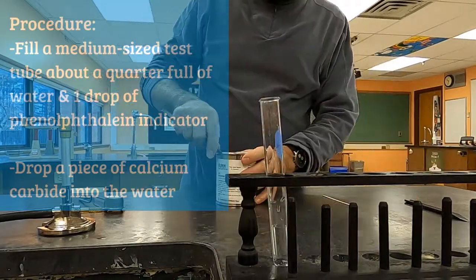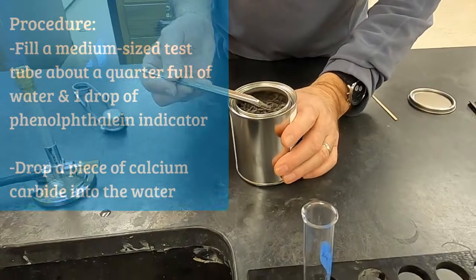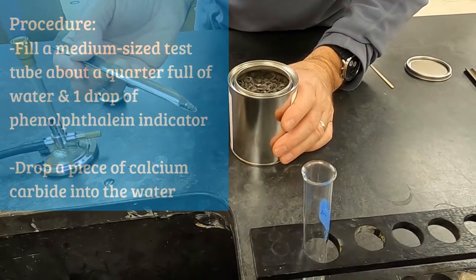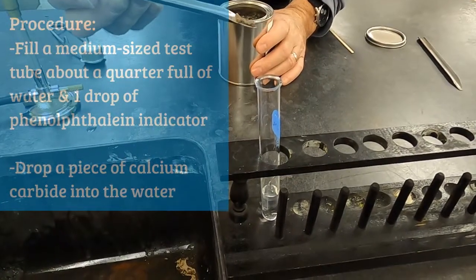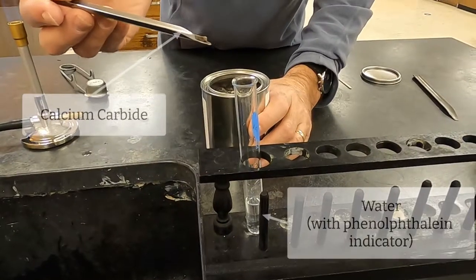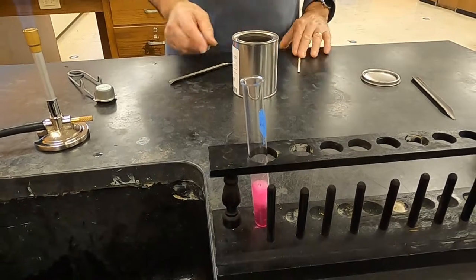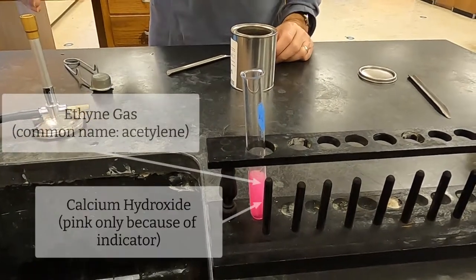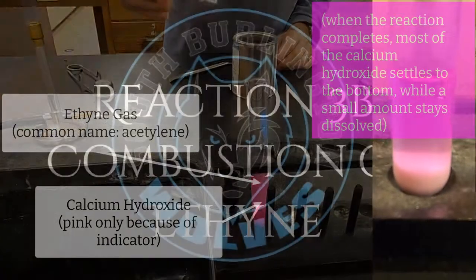We're calling this reaction 3A because we're going to do something interesting with the gas that's produced. What you're doing is you're just going to be putting in a piece of calcium carbide into water. We're going to use an indicator to show one of the products, the calcium hydroxide. It makes the water turn pink when there's phenolphthalein indicator. Phenolphthalein is not a reactant or a product in this case, and you would not include it in the balanced chemical equation.